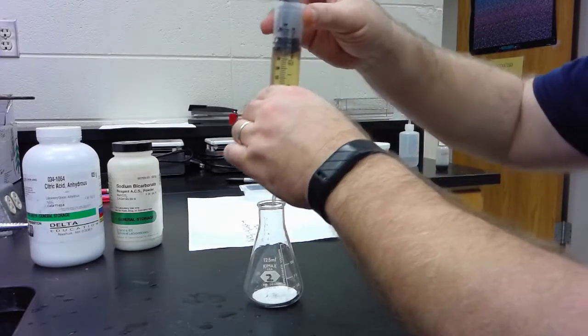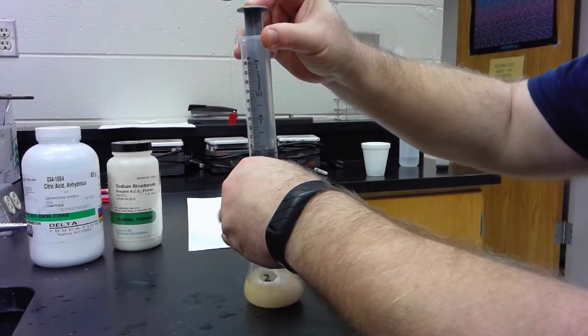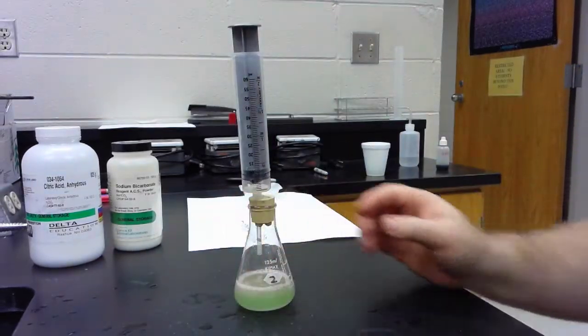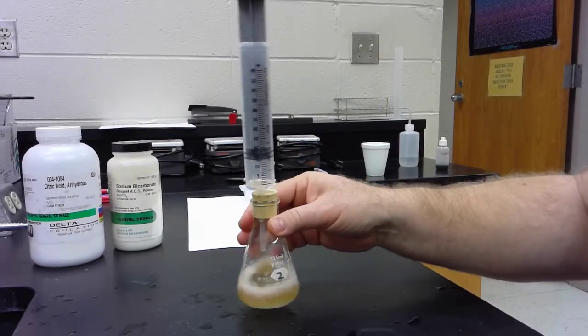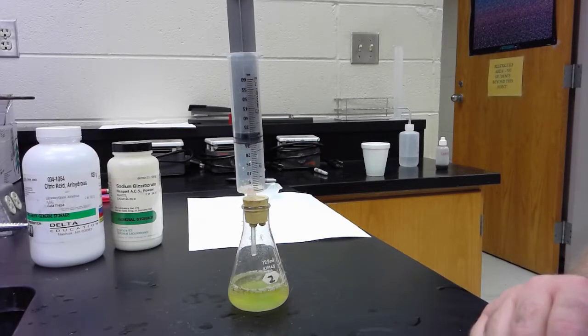Invert this, let's pour most of the water in before I seal it. And you can see we're starting to blow some gas bubbles. The indicator solution turned a little bit red immediately. We're kind of back to green now.